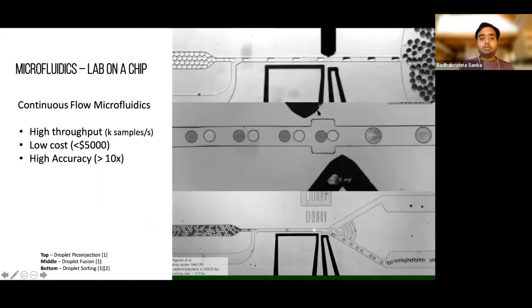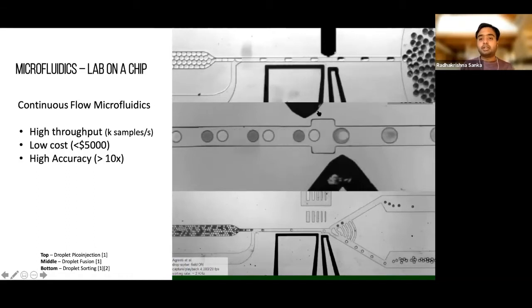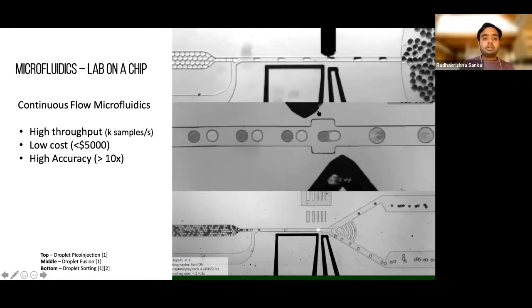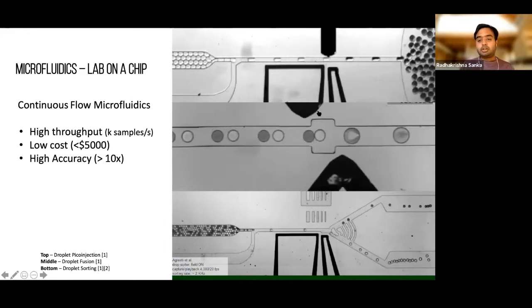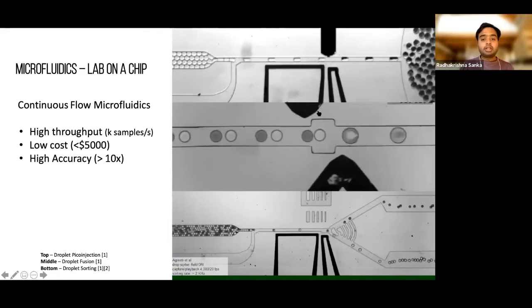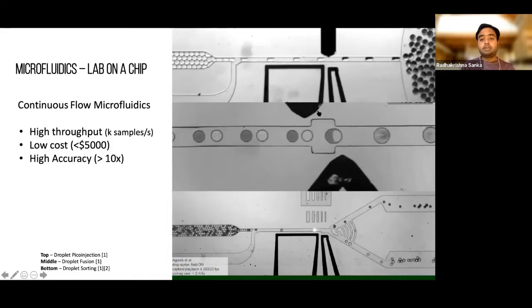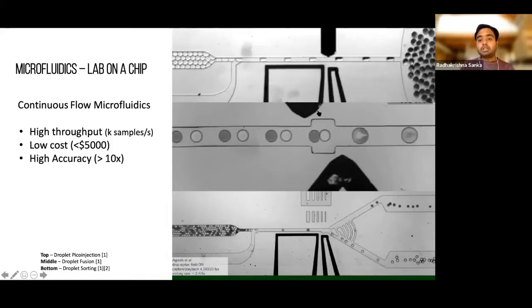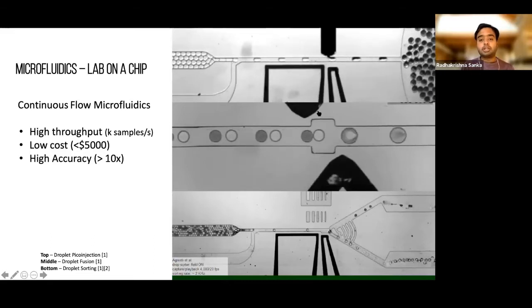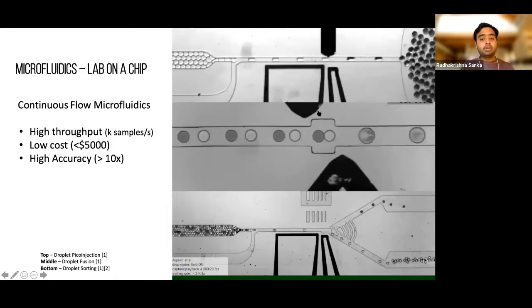So as most of you know, microfluidics and lab on a chip is something we're all familiar with in the space of synthetic biology or design automation or bioautomation. The three main reasons why we would want to use microfluidics is because you could get really, really high throughput. The examples on the right are example devices from droplet microfluidics. The top one is doing pico injection, where you inject a small amount of reagent, picoliter volume of reagent, into a droplet. The middle one is where two different droplets, that means two different samples, are getting merged one after the other.